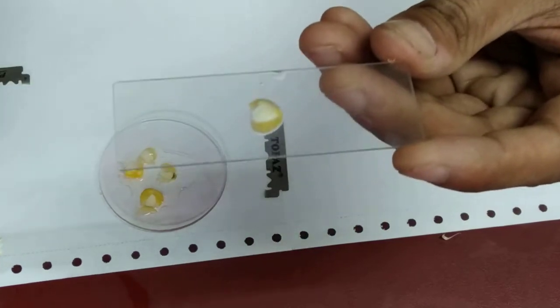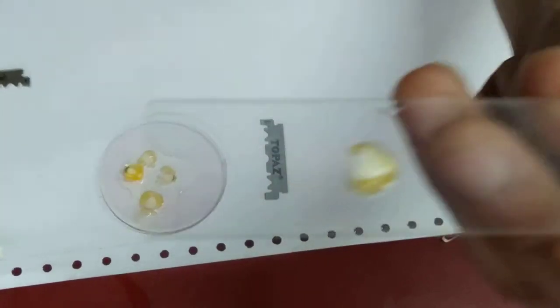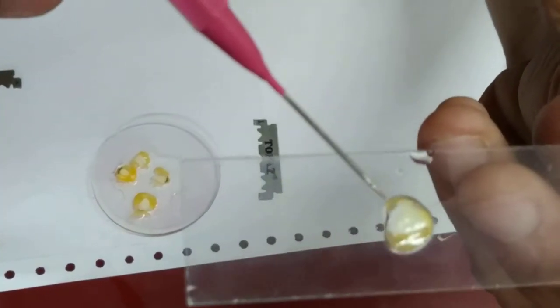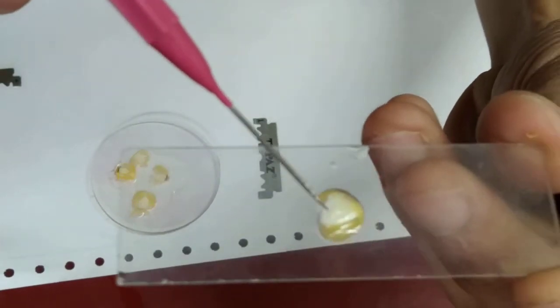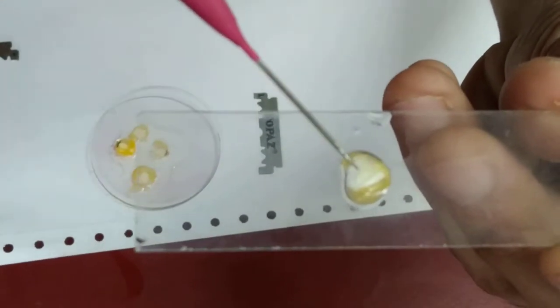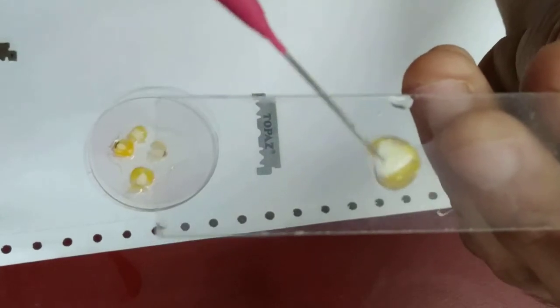So just take a look at this one. If you look properly on the inner side you can see the plumule and the radicle over here.